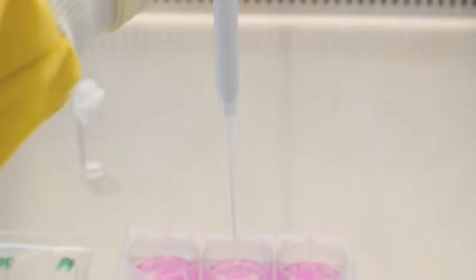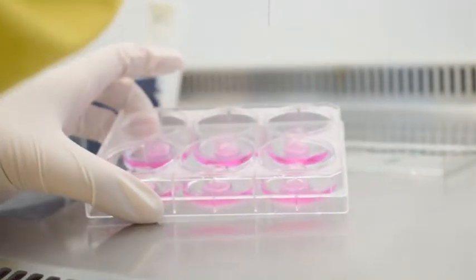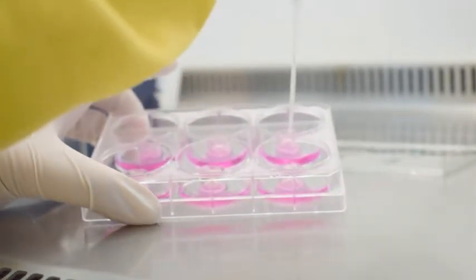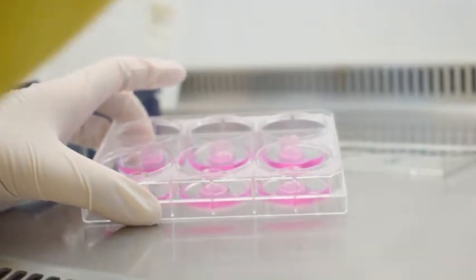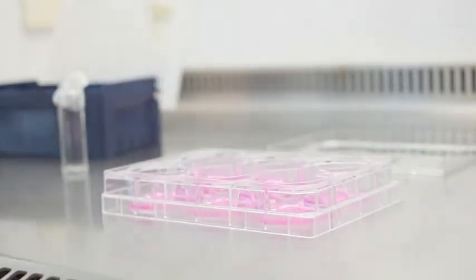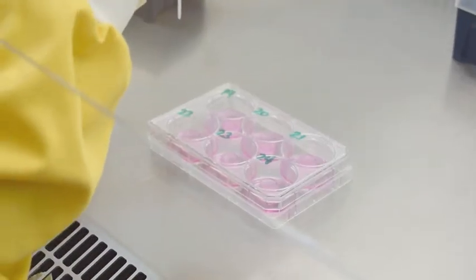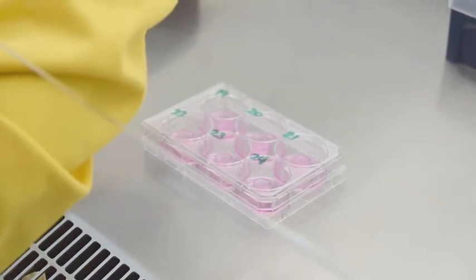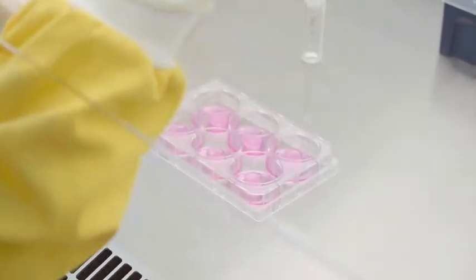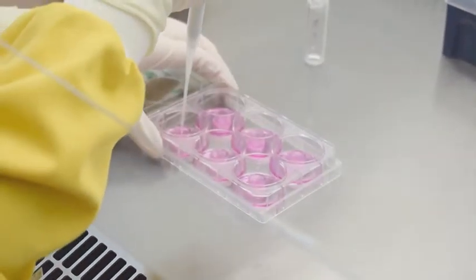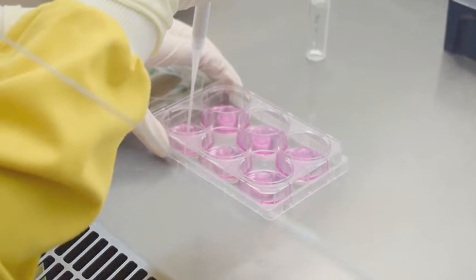A positive displacement pipette is used to administer the test article on the topical surface of the tissue. This enables pipetting of acetone, which all test articles must be delivered in, as this will evaporate off the tissue surface. 10 microlitres of test article is sufficient to treat the tissues topically.